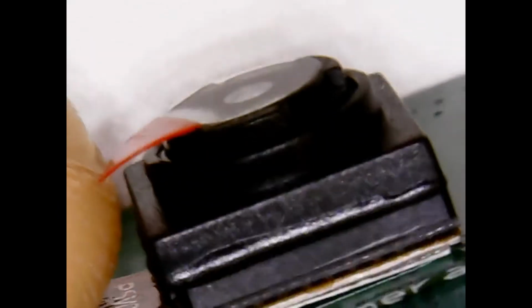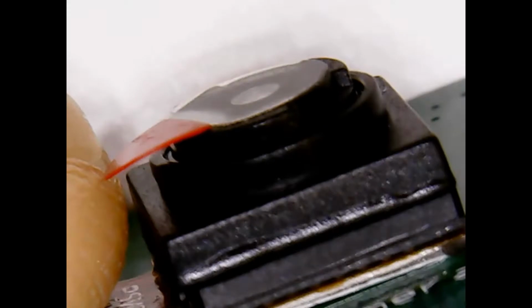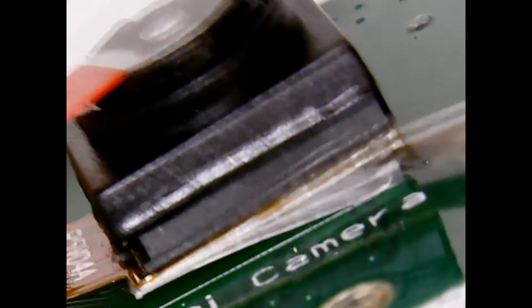So we're going to turn it sideways. We're going to pinch the connector down so it doesn't pop out. And then we're going to remove the double stick tape protector. There it is. Peel that off. And so now, oopsie. There it is. I'm using an X-Acto blade. I got that. There's the paper removed. Now the sticky's ready to go.